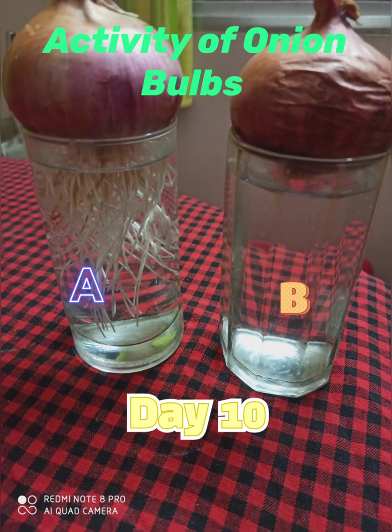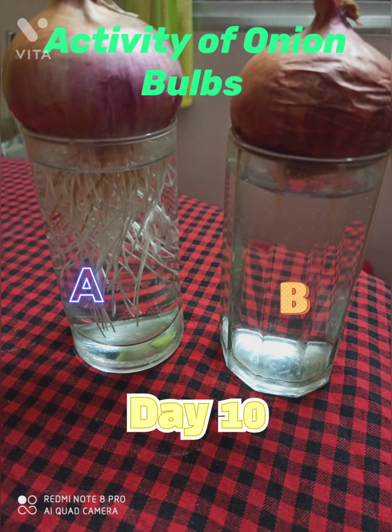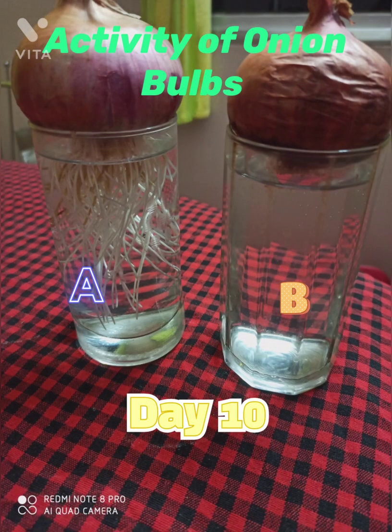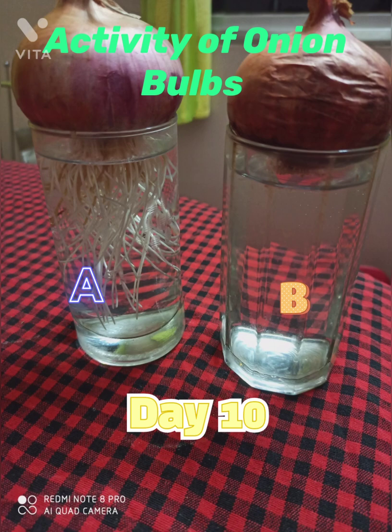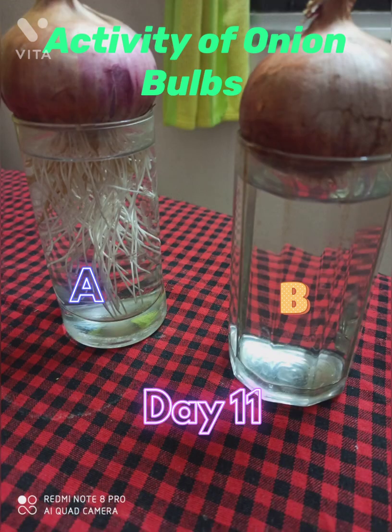This is day 10. In beaker A the roots have covered almost the whole glass tumbler, whereas in beaker B there is no growth as the root tips were cut. This shows that root tips contain apical meristem, due to which growth occurs.